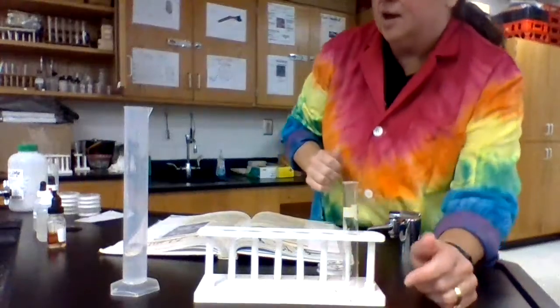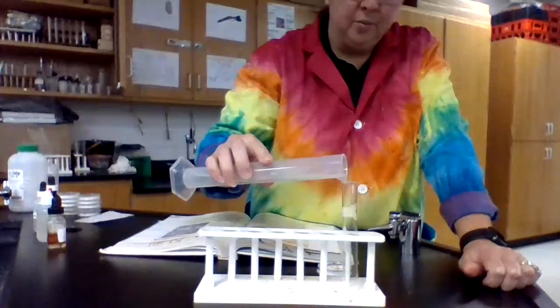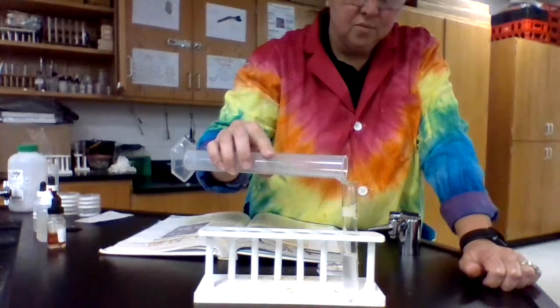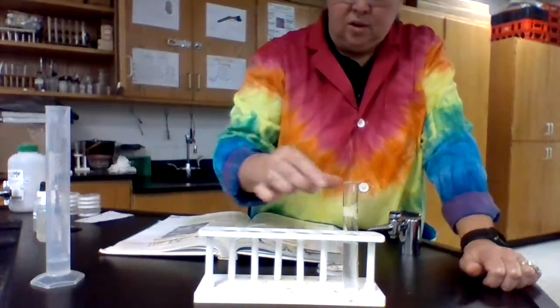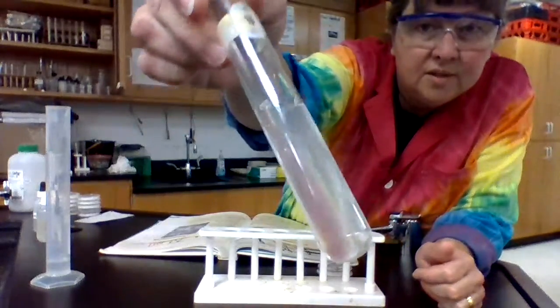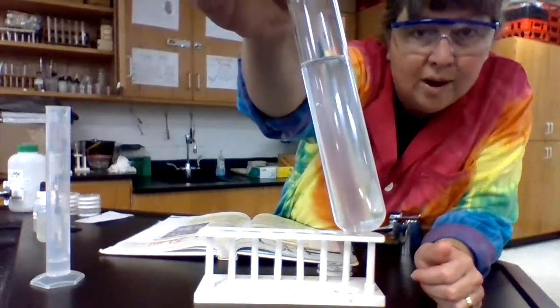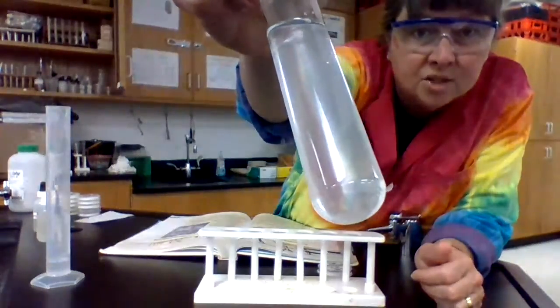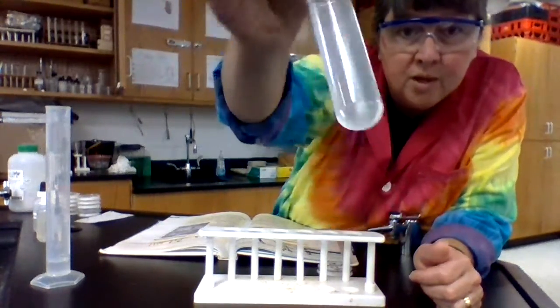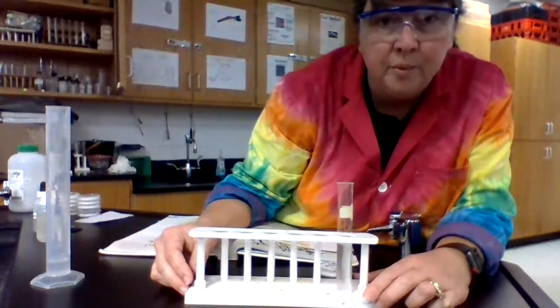Just like what we did earlier, we add water to the sample. All right, and then we'll mix it up a little bit, but this is definitely not very clear. You can definitely see that there are particles floating around in there, so it's not soluble in water. That's the first test after the microscope. So the solubility test is test number 2, after the microscope, which is on the picture.